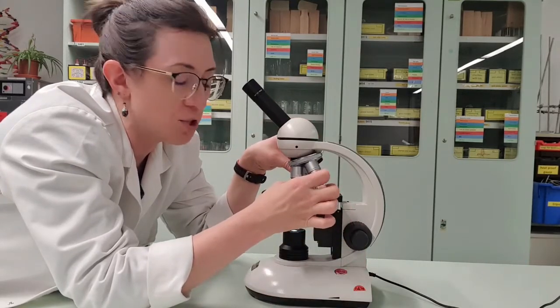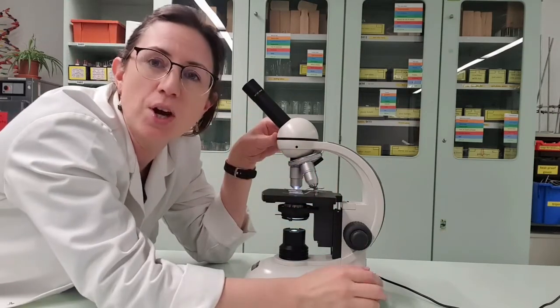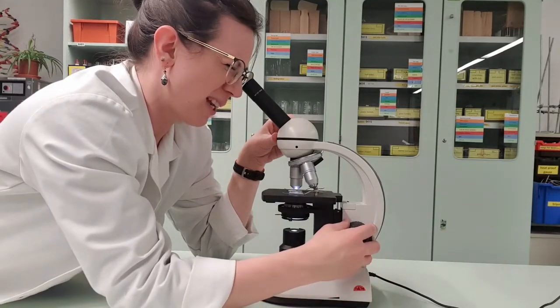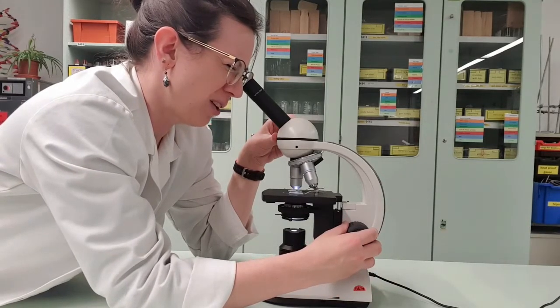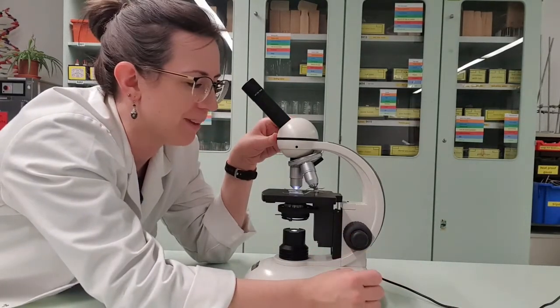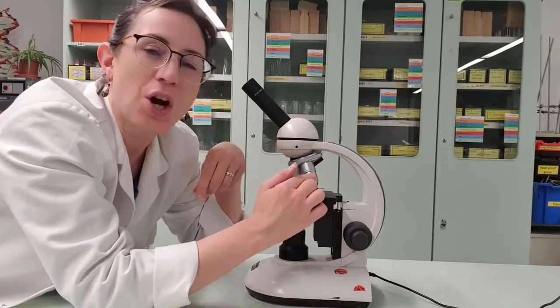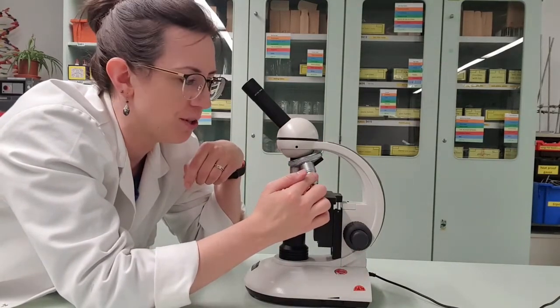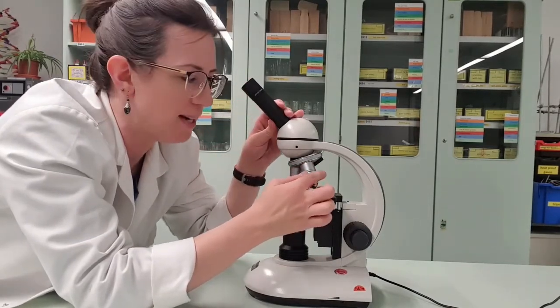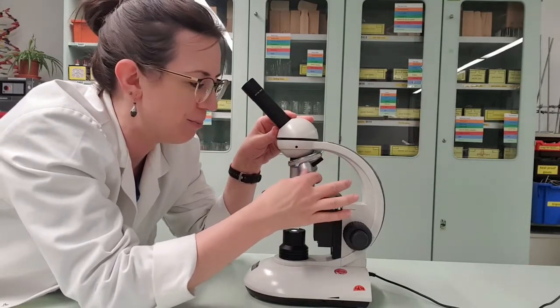Once you've found the image on the smallest objective lens and it's really crystal clear, you're ready to move to the next objective lens, which is ×10, or 10 times 10 would be 100 times magnification. If that's still not quite clear, just tweak the rough focus a little bit to bring it into view. Then, for the best one, this is the ×400 magnification. It's a ×40 objective lens times 10 in the eyepiece. So this is going to be 400 times bigger than it is in real life.